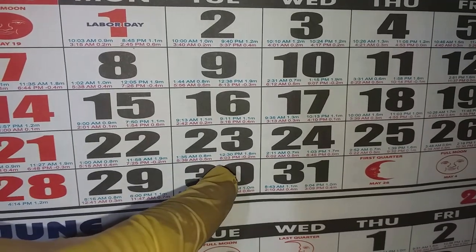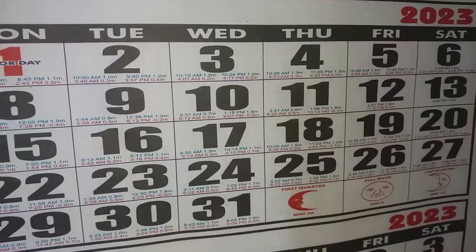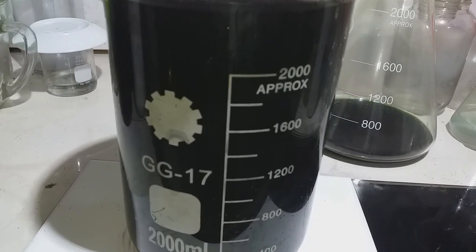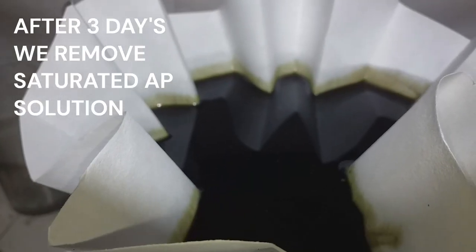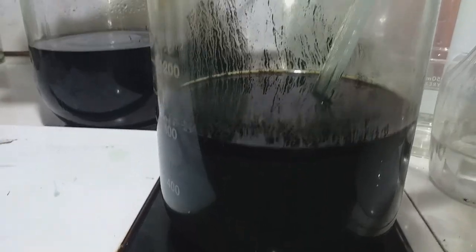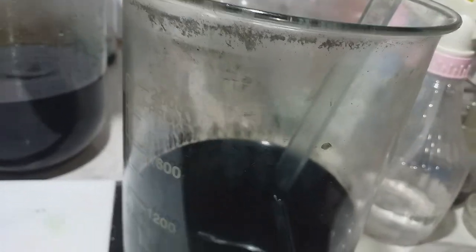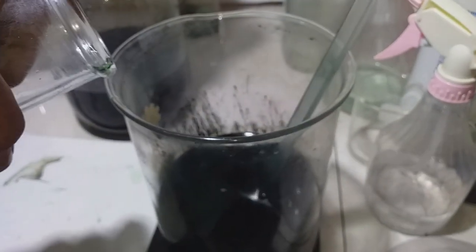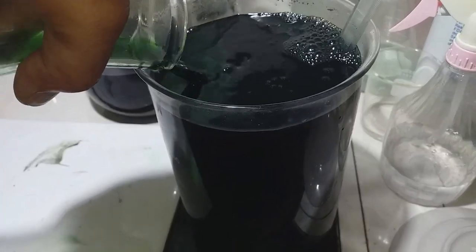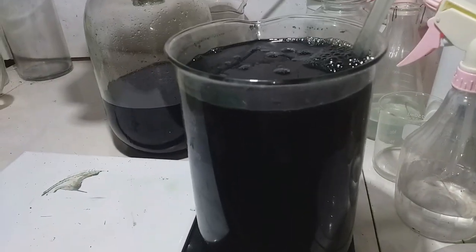It is now day 23, 24, 25, 26 — Friday. Let's take a look. We stir this two to three times a day. After removing the saturated liquid, we add fresh copper chloride solution and run for three more days, stirring three times a day.